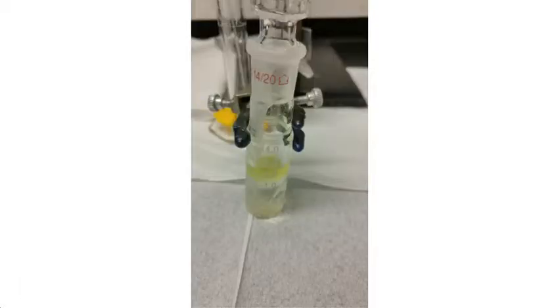At this point, all that's left is the neutral component. We don't actually have to do any chemical reactions necessarily for this. Ether, again, is highly volatile, and when put on heat will evaporate very quickly, so all we have to do is evaporate the ether gently so that no accidents happen, and we'll be left with neutral crystals that are already dry.